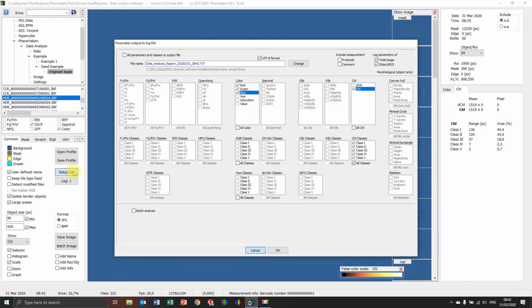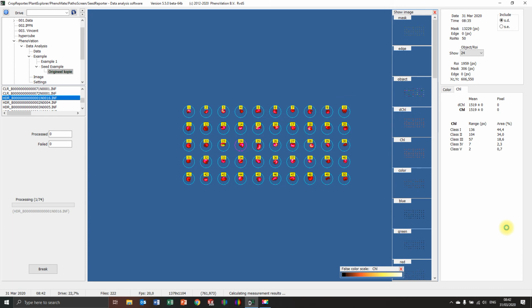But if you do want to do batch analysis, you see now 222 files are detected. I don't want that because in this case, we also have color images in here, but we only want to measure the HDR file. So we say HDR and then underscore B and then star, press enter. And then indeed we have 74 that we already had. I'm going to do a batch analysis now. So I say I want to calculate all the images with these settings. Okay, let's go.